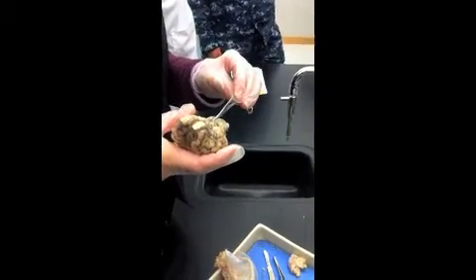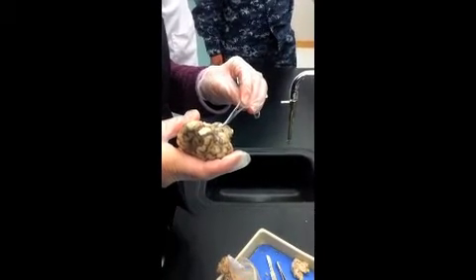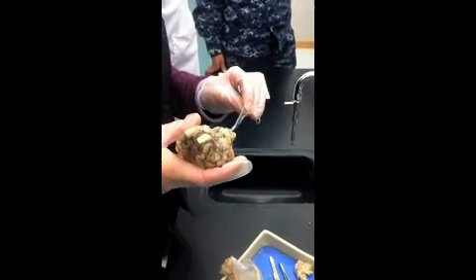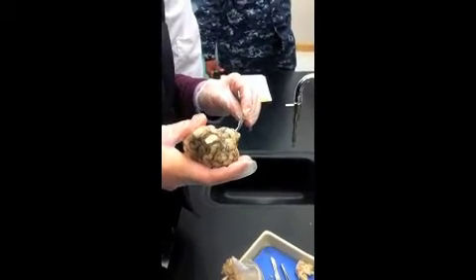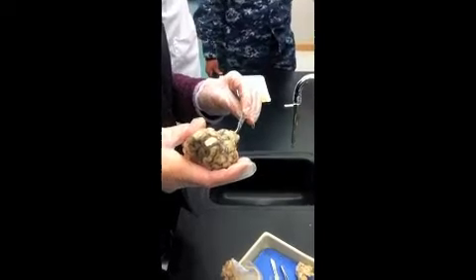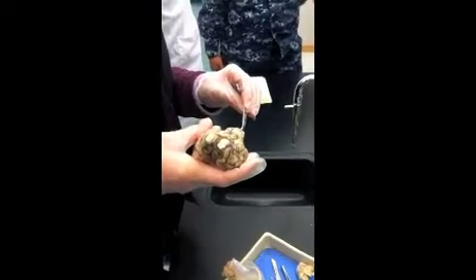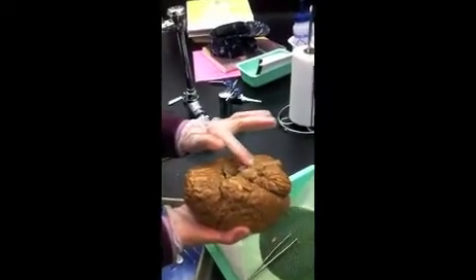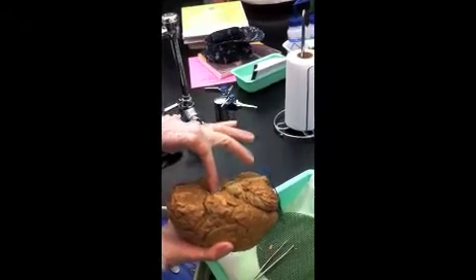We actually have a lot of, it's called the corticospinal tracts, which carry motor impulses from the brain down to the spinal cord, running through there. And then the rest of the brain stem is called the medulla oblongata, where we have a lot of vital reflex centers for breathing, heart, etc. On the human brain, the pons is a little bit more obvious right there. This is the medulla. Midbrain in here, diencephalon there.